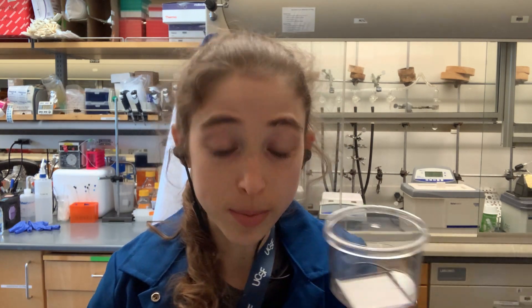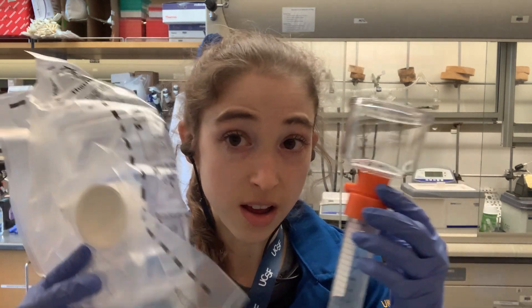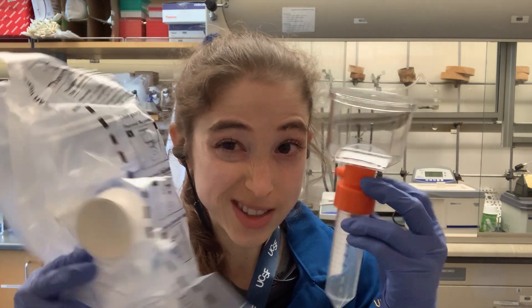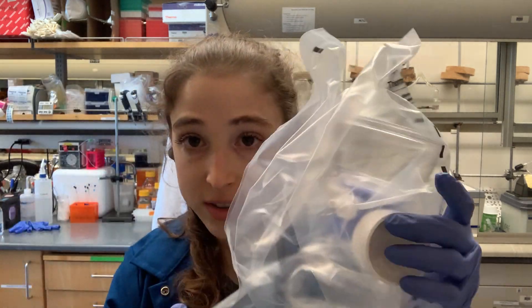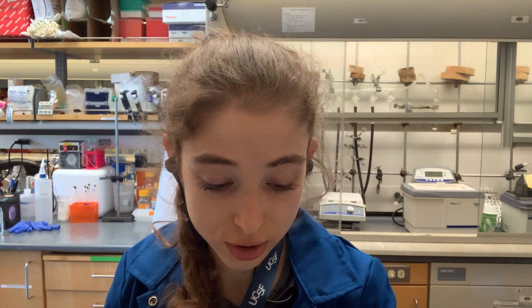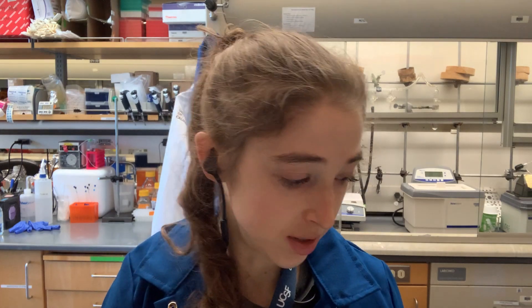How do you choose? One factor is volume. If you have a bigger volume you're typically going to use vacuum filtration, and these come in different sizes. There are sterile ones that come pre-assembled, and for bigger sizes they'll just come with the top part that you hook onto your bottom container, plug in, and hook up to the vacuum.